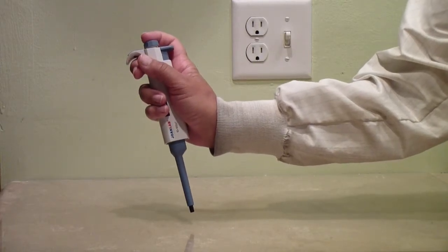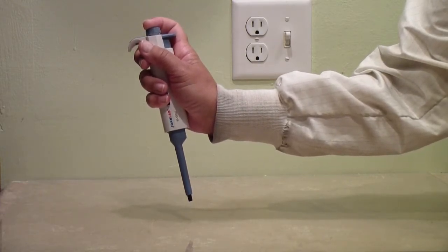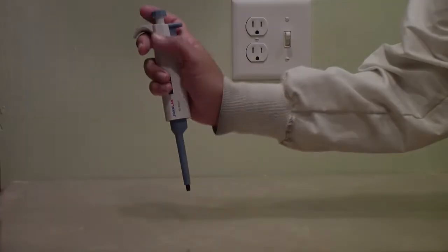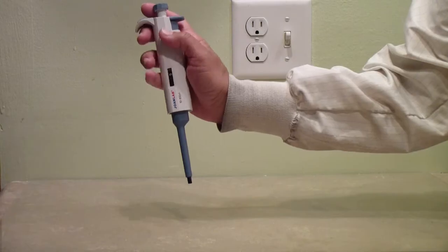The first and second stops serve different purposes. To release the plunger, do not simply remove your thumb or finger from it. Instead, guide the plunger upward so that it does not snap up.